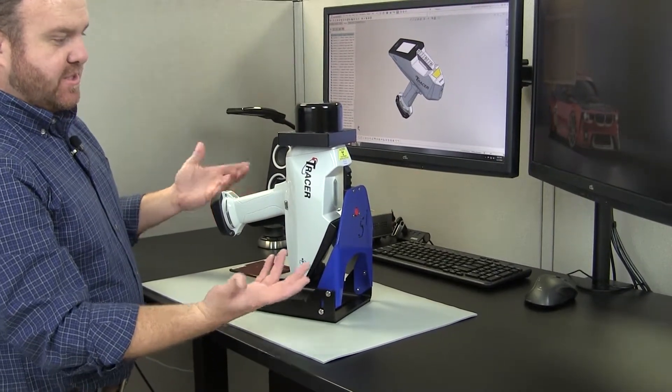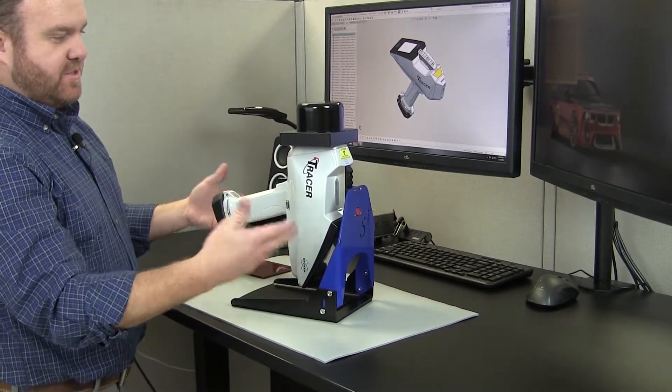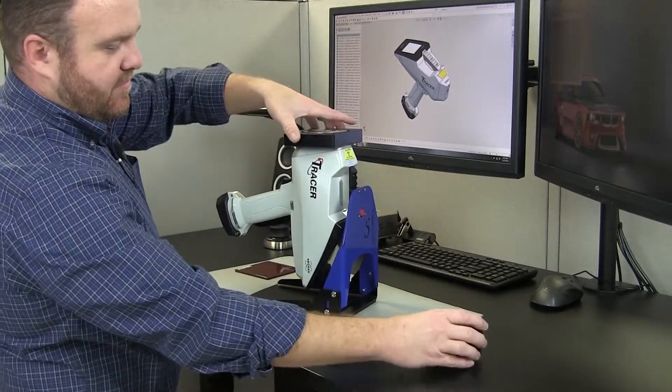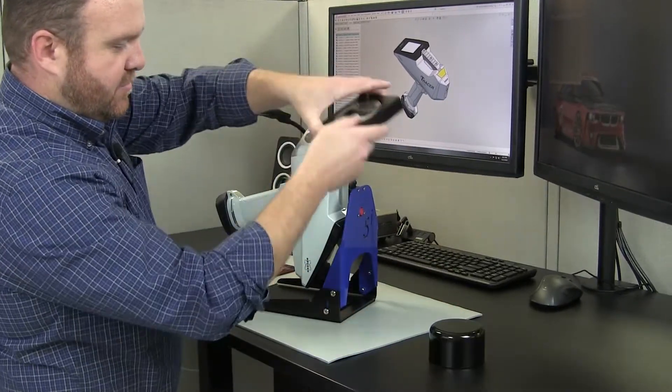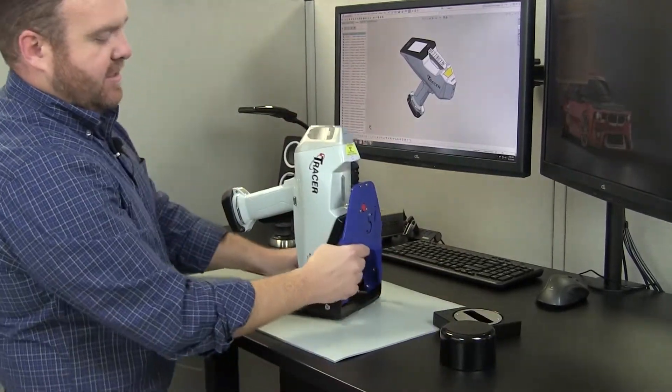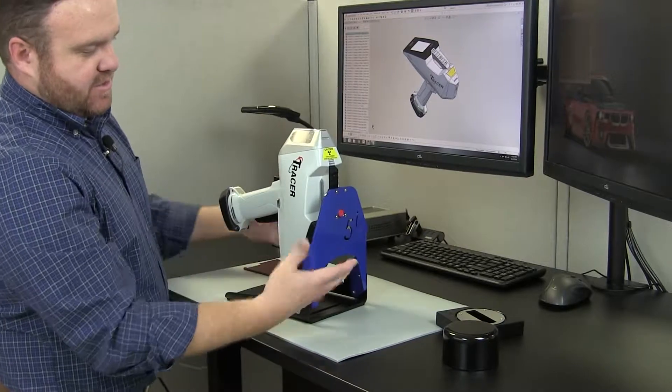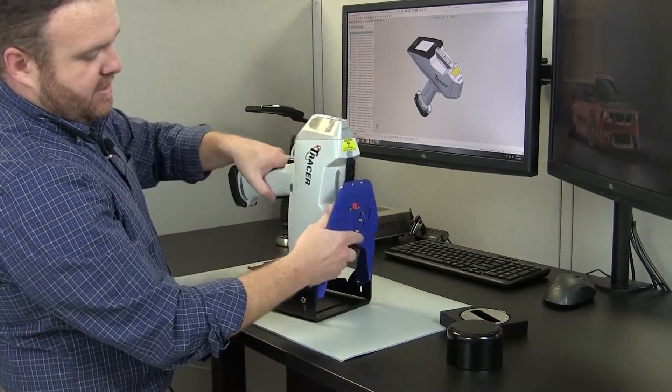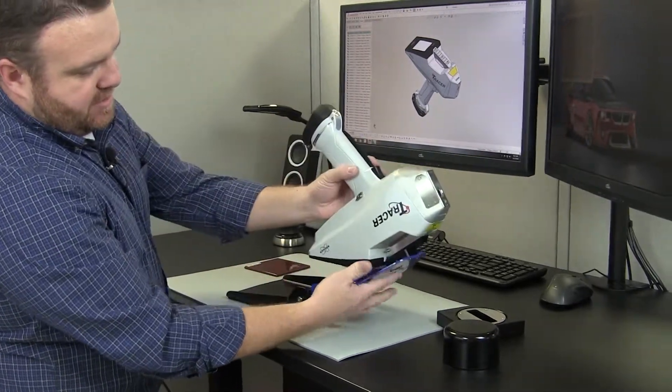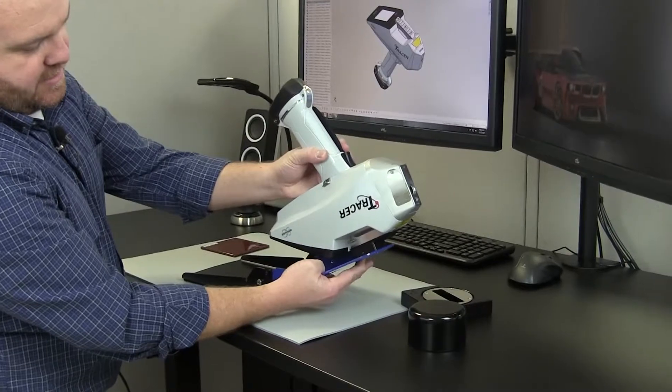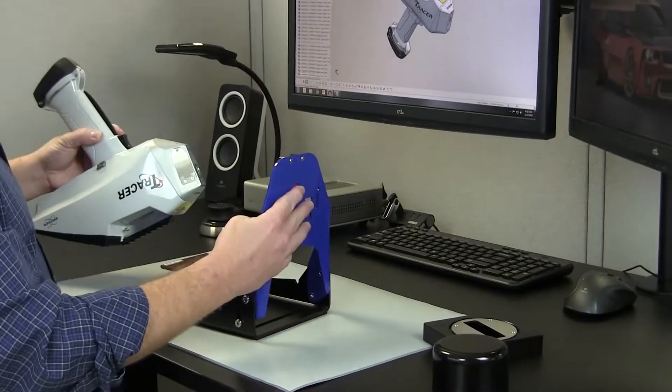The second position would be the nose down position, which is kind of unique. There's a few opportunities to be able to use that. To get it back to that point, lift it up, hold the button, and slide the instrument out.